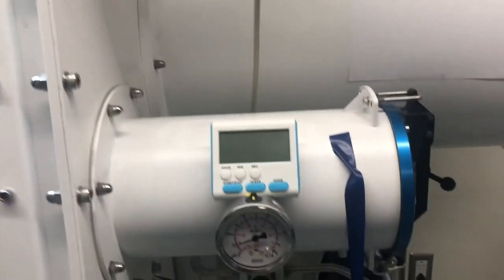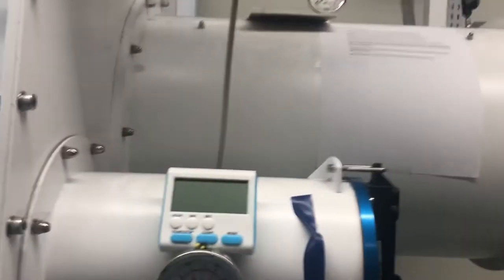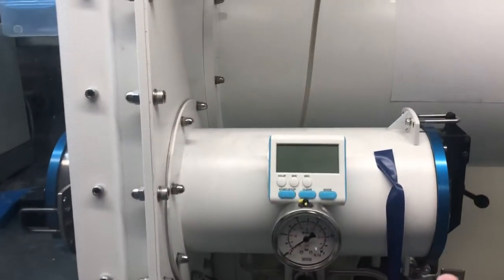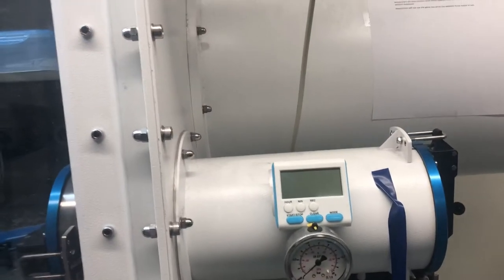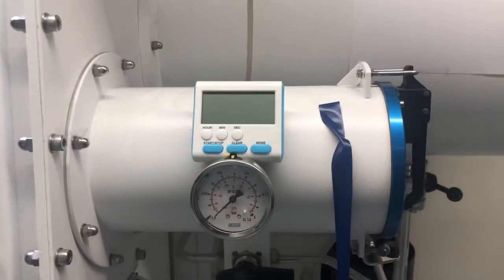Set the timer, set a timer on your watch, set a timer on your phone, whatever you need to do. Come back in 20 minutes and then you're going to release it to argon again. And after you flip it to argon, you're going to flip it back down to vacuum and you're going to let it sit for 10 minutes. So the sequence goes 20 minutes, 20 minutes, 10 minutes.